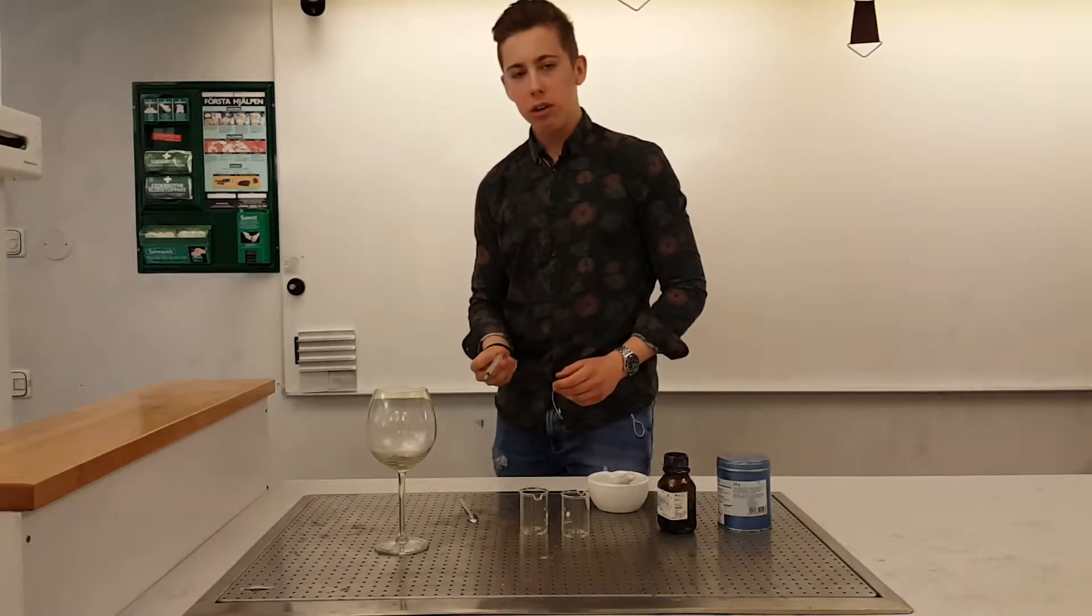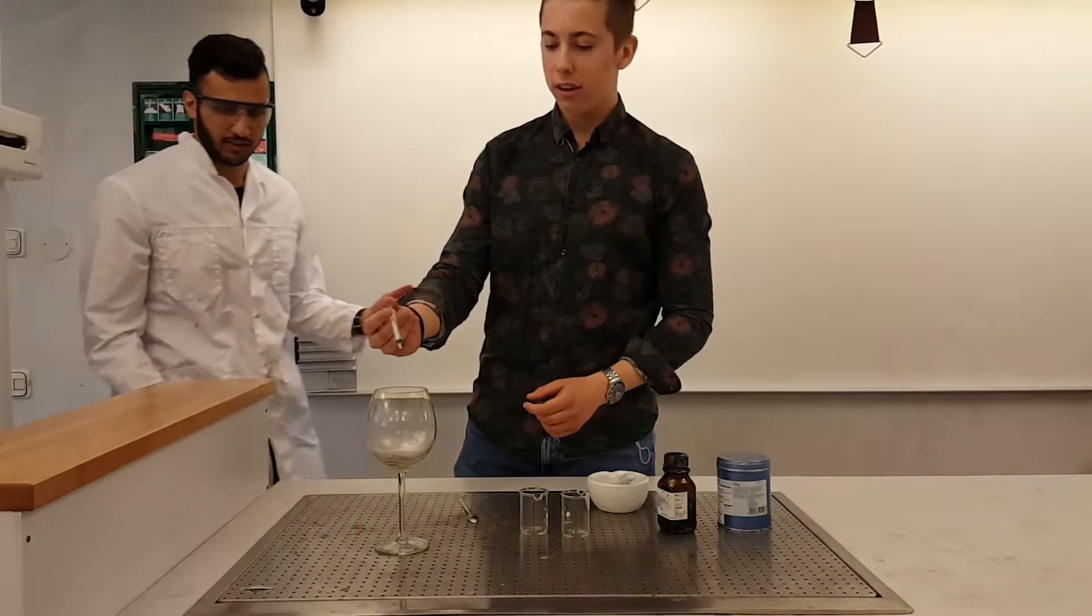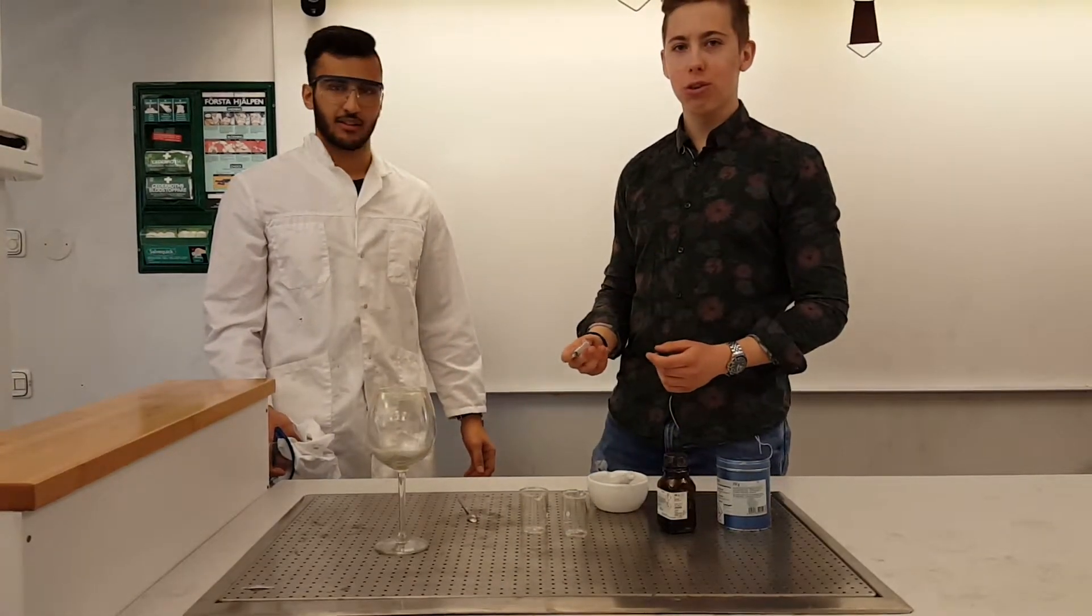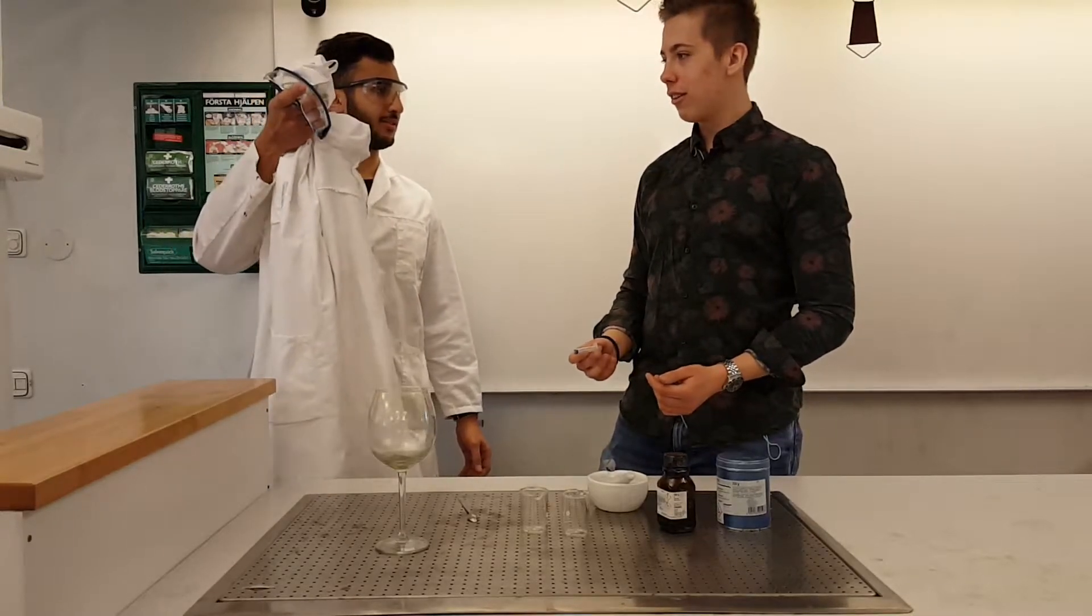So now we've demonstrated what happens when I put two drops of water inside. Wait, wait, what are you doing? I'm trying to show some students how to survive on an island. You can't do that. Why not? You need to use the right safety equipment.